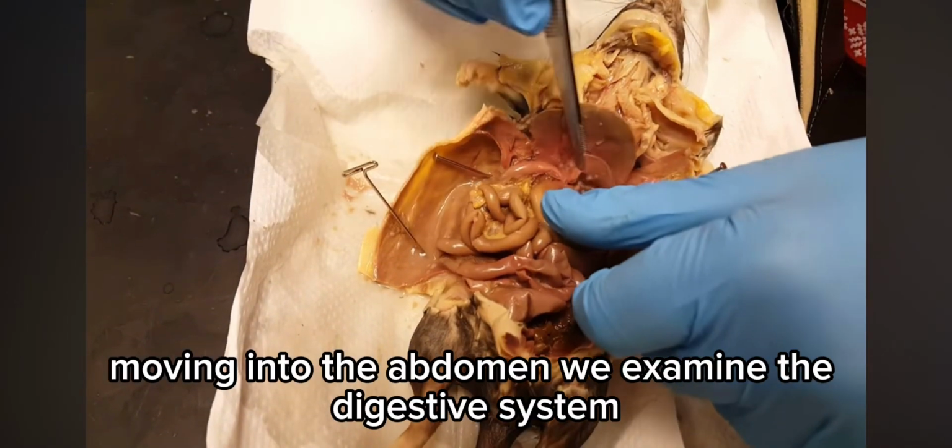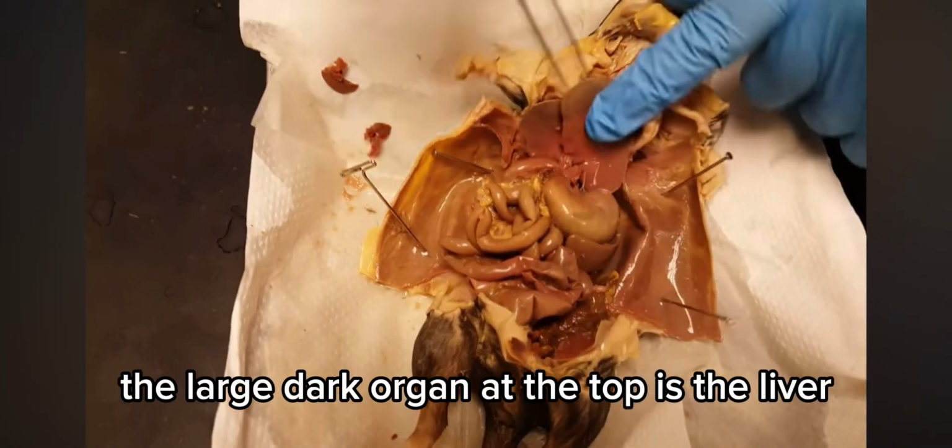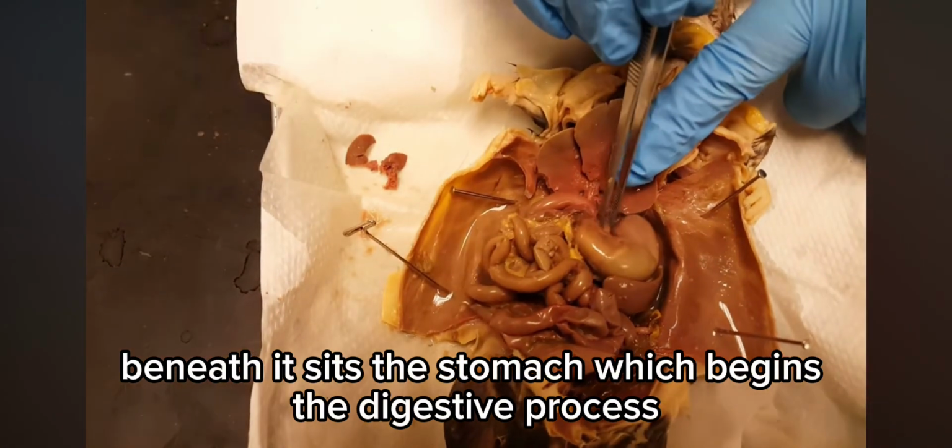Moving into the abdomen, we examine the digestive system. The large dark organ at the top is the liver. Beneath it sits the stomach, which begins the digestive process.